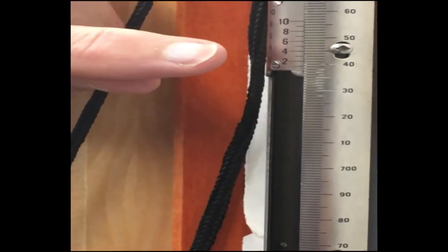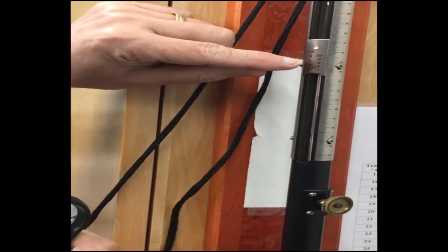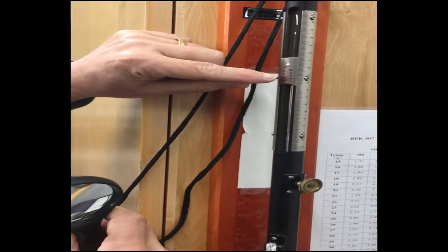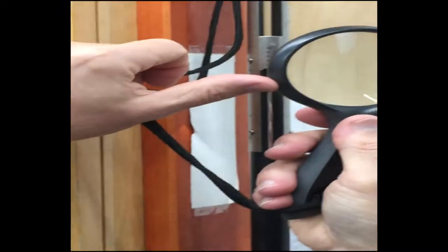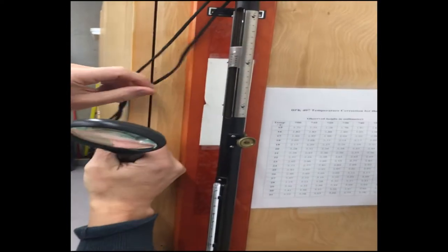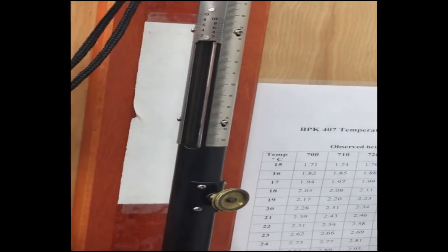This top is called the vernier scale, and it allows us to determine exactly what the decimal point will be. I'm looking at that and I can estimate that it's about 737.2 or 0.3. Now if I look at my vernier scale, I can see that the number 3 is lined up directly with the line across from it.